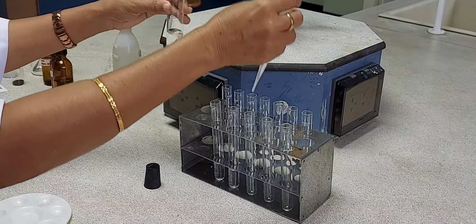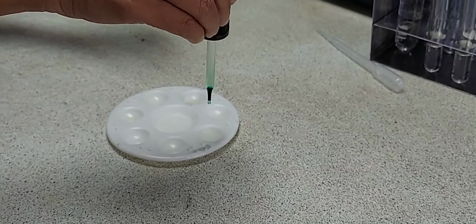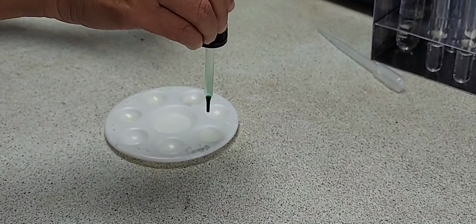You can closely observe the reactions and the speed with which the reaction is happening, because this experiment is all about the reactions taking place with 4 acids. So first I am taking ethanoic acid and reacting with universal indicator. A few drops of the universal indicator is added, and then I am going to determine the pH of ethanoic acid using a pH paper. So you can see that the pH is around 3.